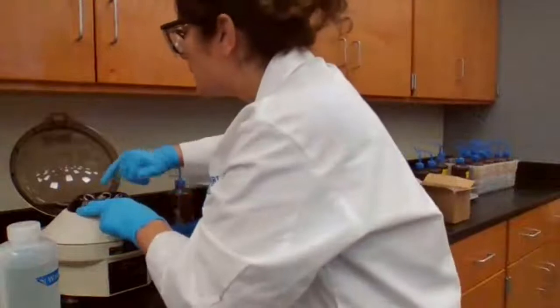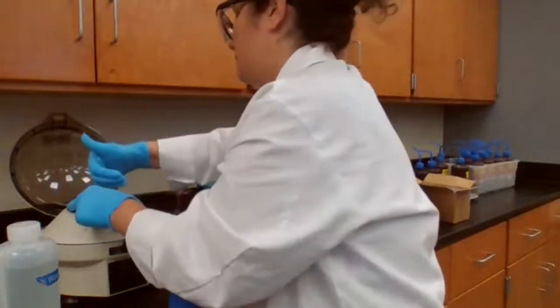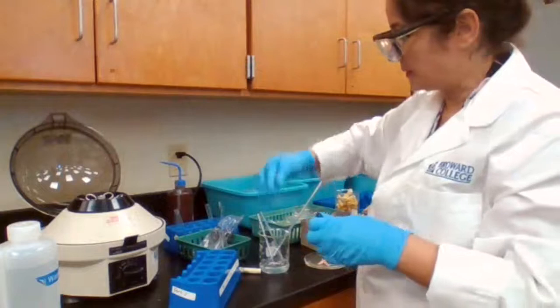Good. This is just to wash the precipitate. I don't need the liquid.